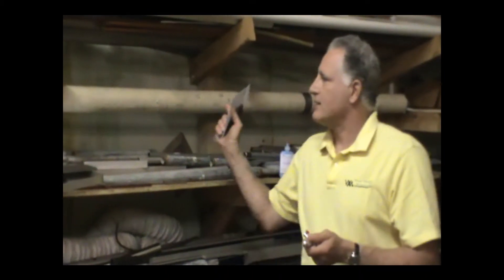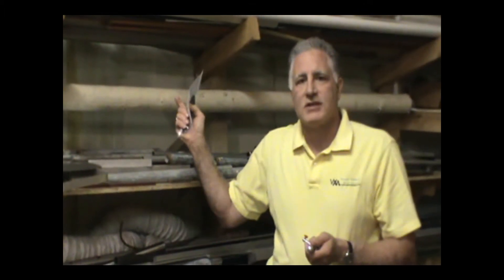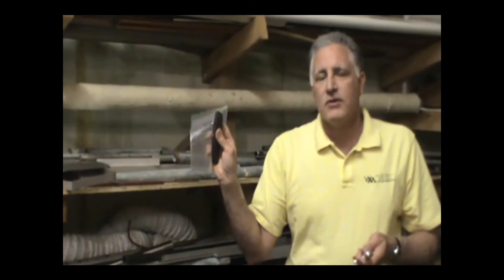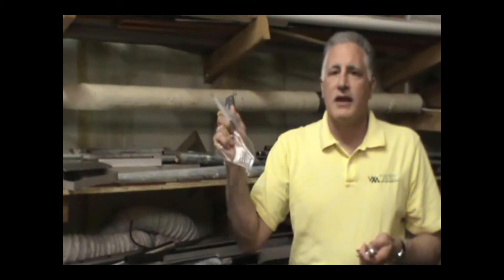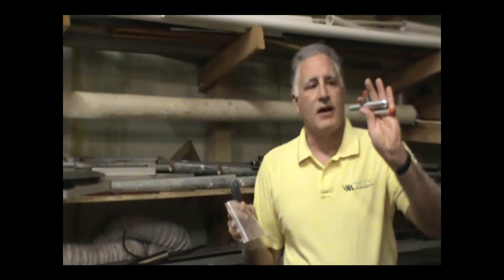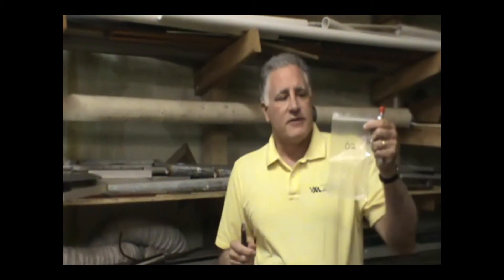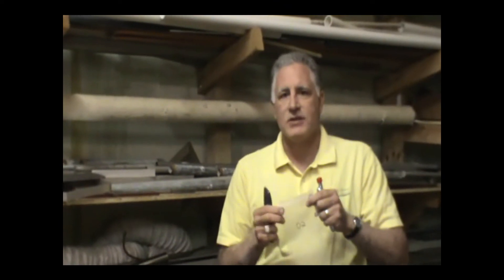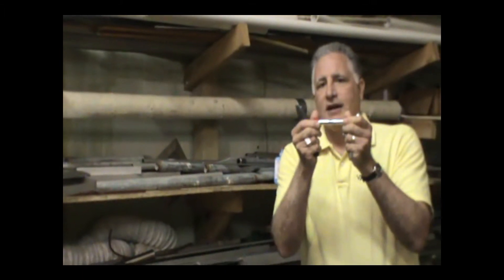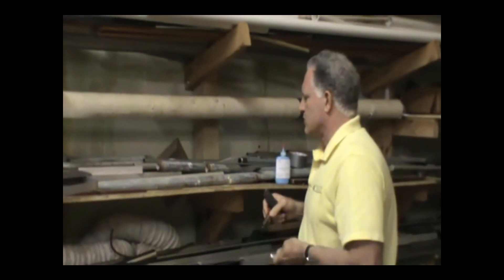Hi, Michael again from Wondermakers. This time I'm here to show you a little bit about how to actually collect a sample of suspect asbestos material. We're going to practice on some pipe insulation here, which is one of the more difficult types of materials to sample. We want to show you the difference between the traditional method, where an inspector uses a razor knife and a Ziploc bag, and the Wondermaker's Core Sampling System, which has this T-handle and the individual cutter sleeves. Regardless of what sampling system you use, you want to make sure everything is numbered — I've got my baggie numbered, my cutter vial numbered, and the numbers right up on the insulation.